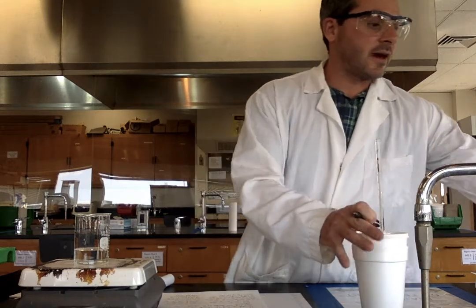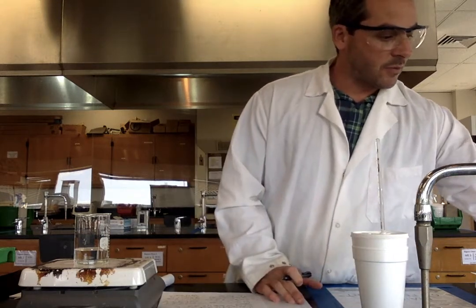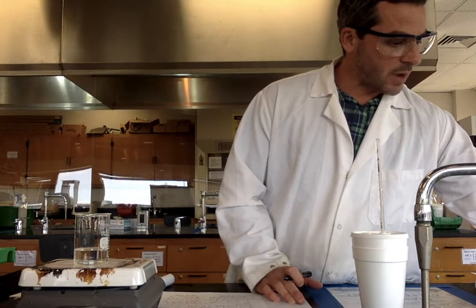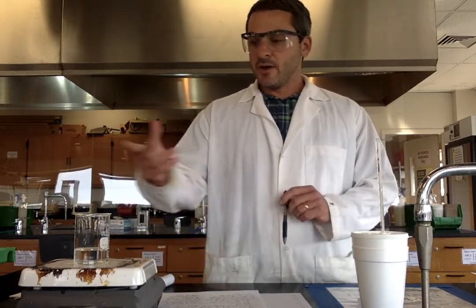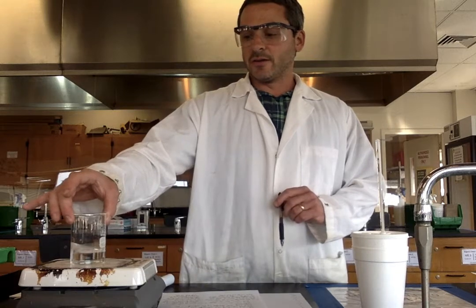And I'm going to set a timer here and just watch every minute for 5 minutes what the temperature of this is. It should not change much while my hot water here is heating up.